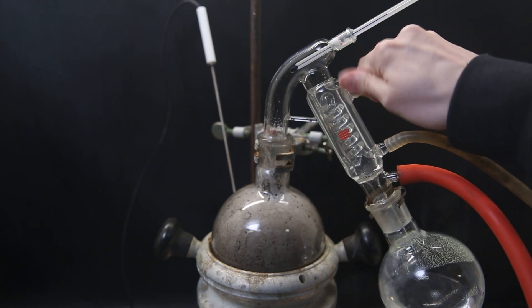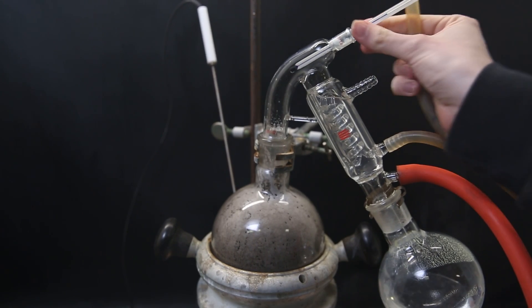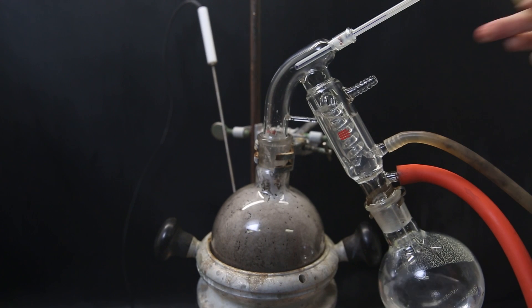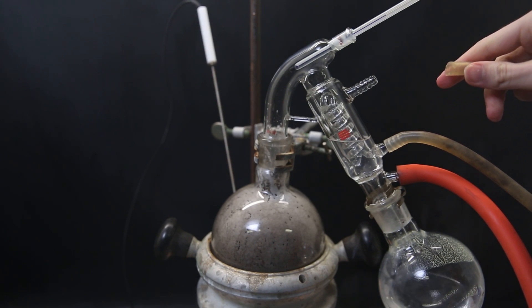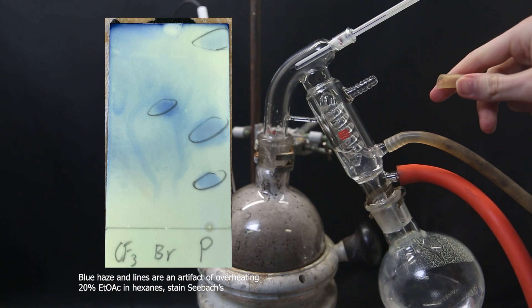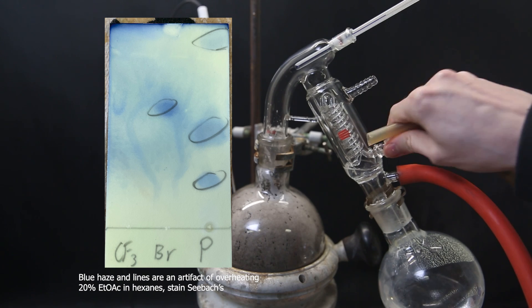This I can use to do column chromatography, which is a method to separate compounds. And the silica gel will help compress the components more tightly into bands and improve separation. Before setting up the column, I run a TLC of this product compared to the starting materials to check the polarity of the components in my product mixture.